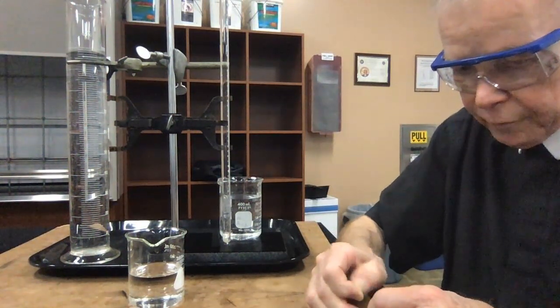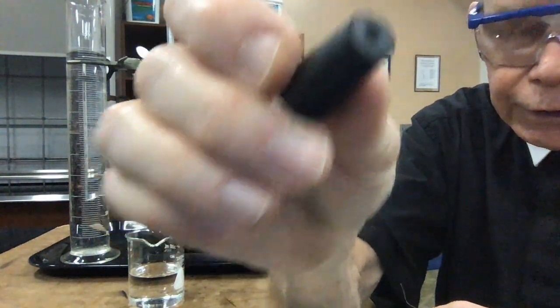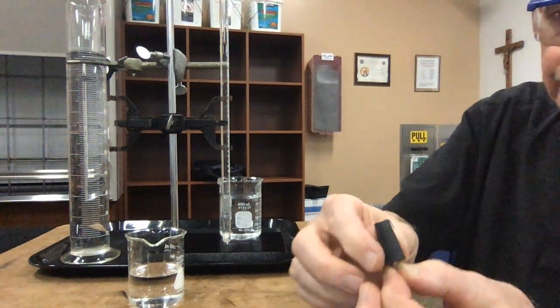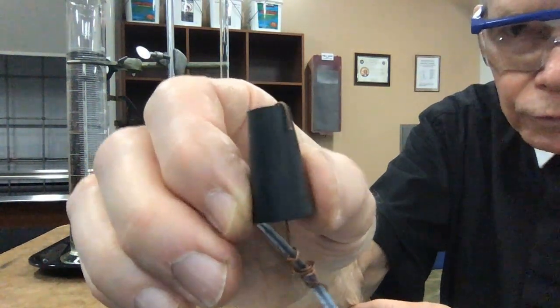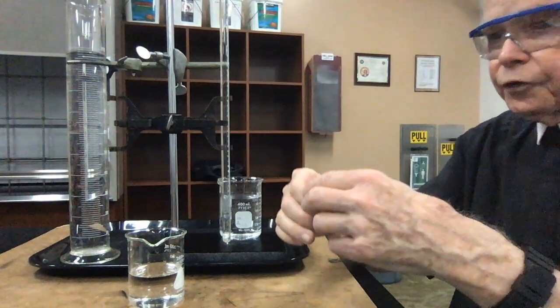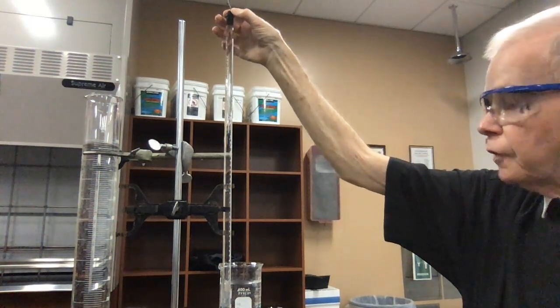Let me now put the copper wire through a little tiny stopper. It has one hole on the top of it. Here's my stopper and a single hole on the end of it. So we'll put that piece of wire through there and kind of bend it over a little bit to hold it in place. Okay, so there's my magnesium. I'm going to take my magnesium now, and I'm going to set it on the open end of the burette, or on the open end of the gas measuring tube. This measuring tube is called a eudiometer, E-U-D-I-O-M-E-T-E-R, eudiometer.